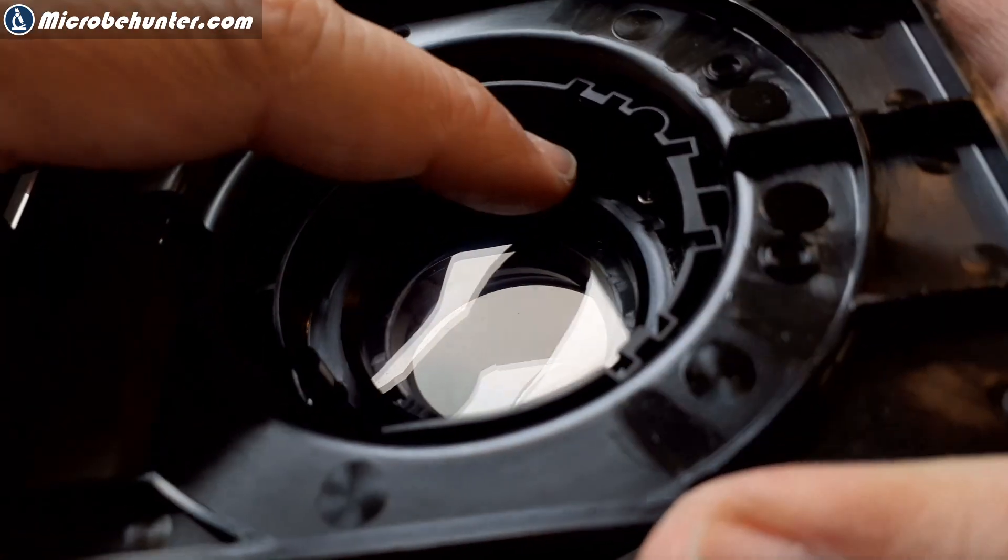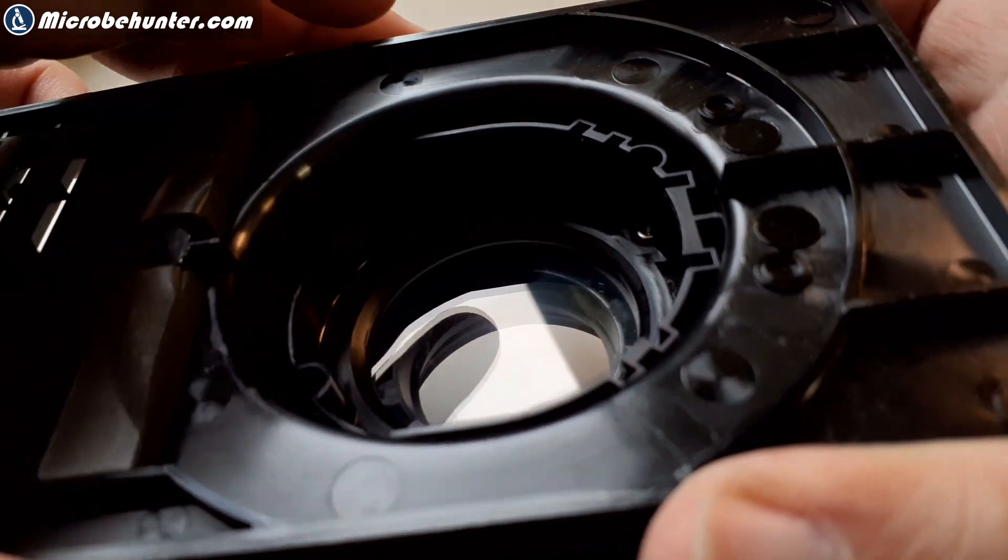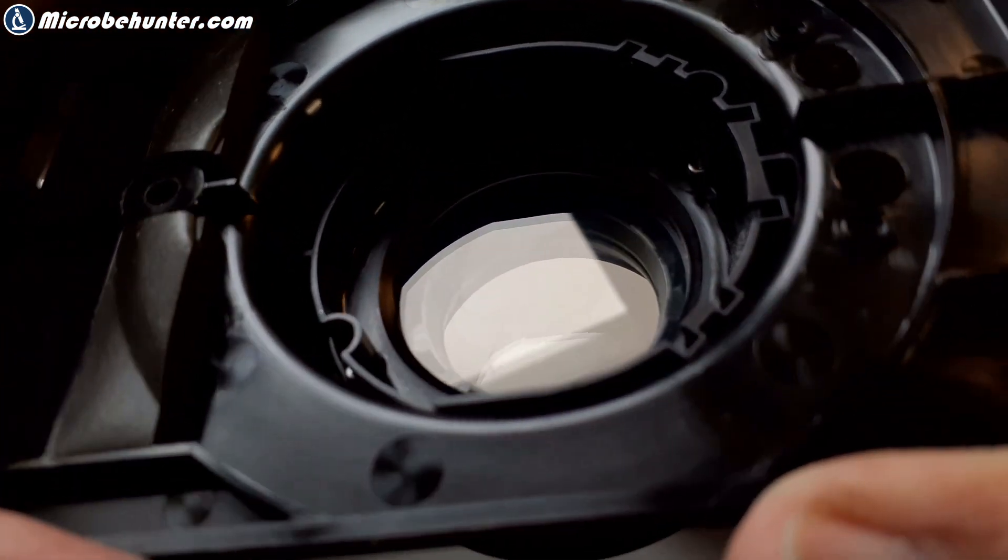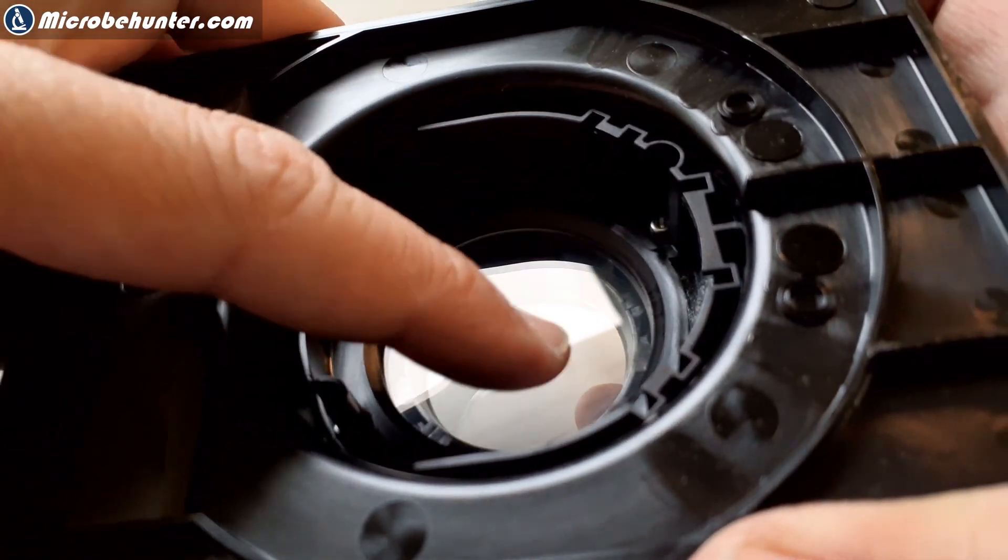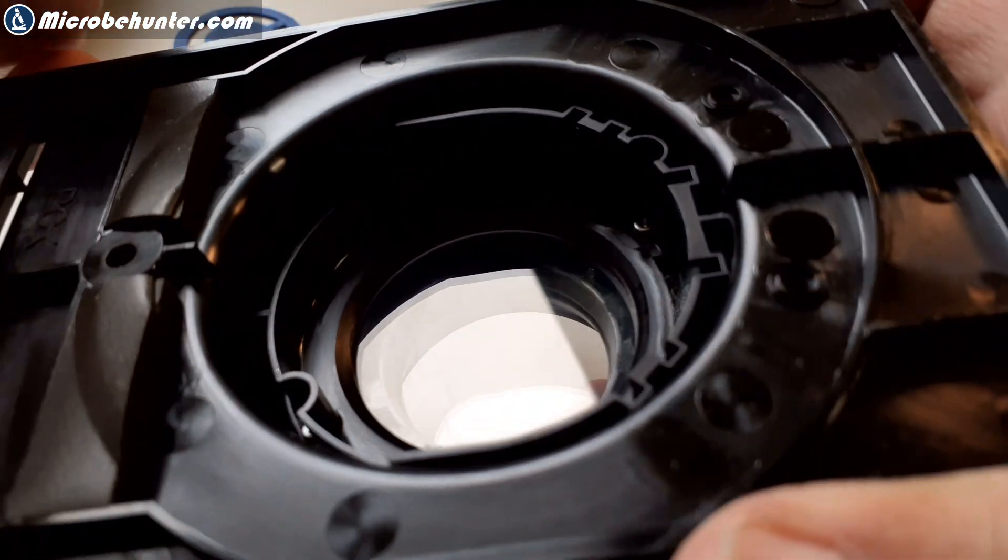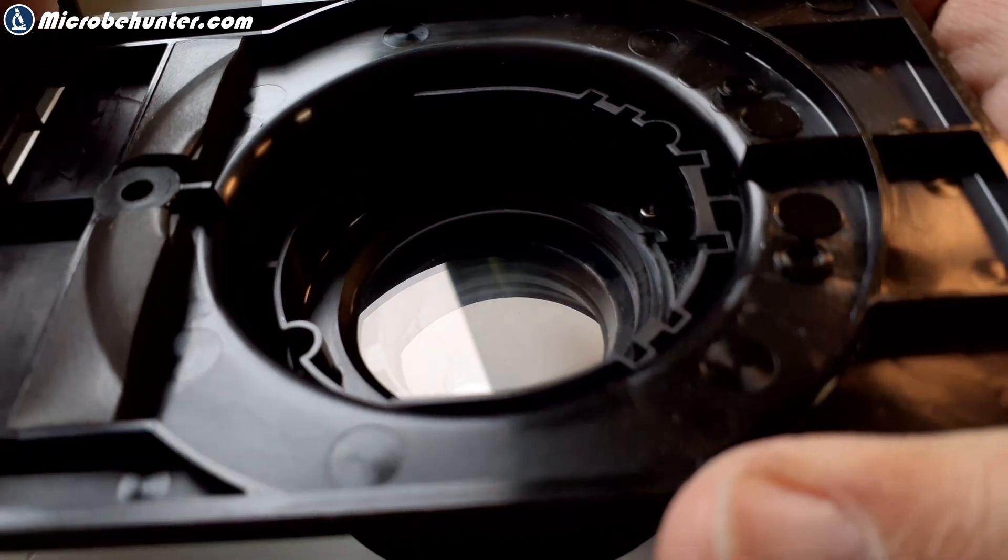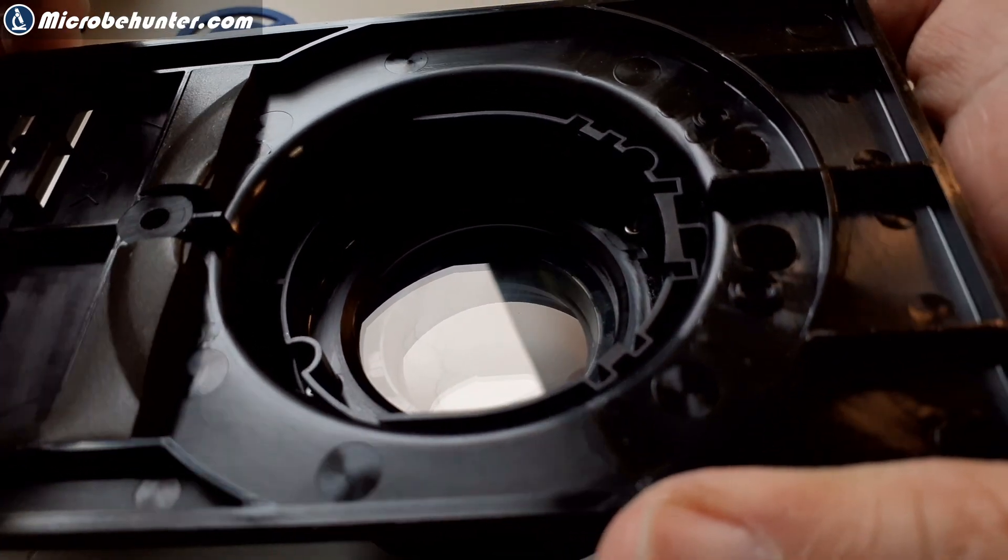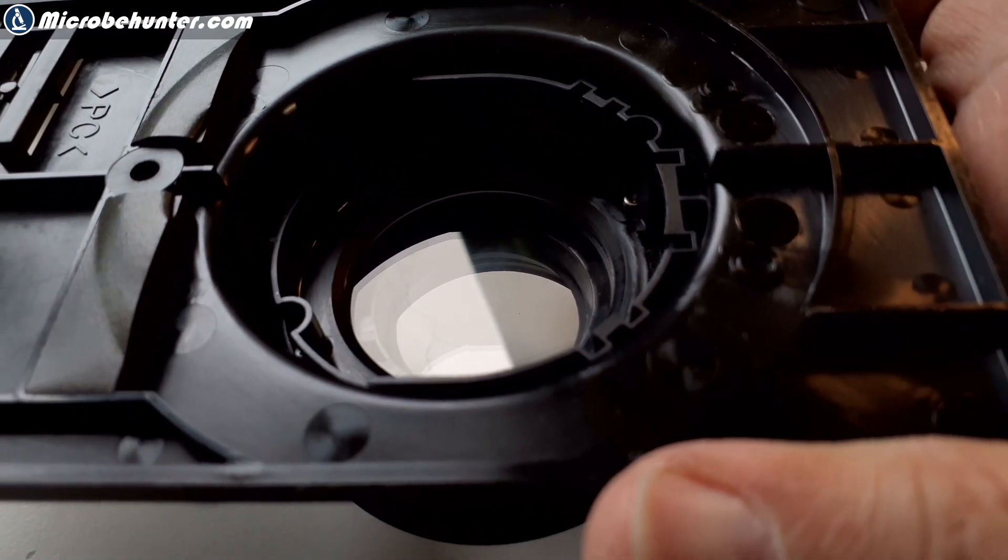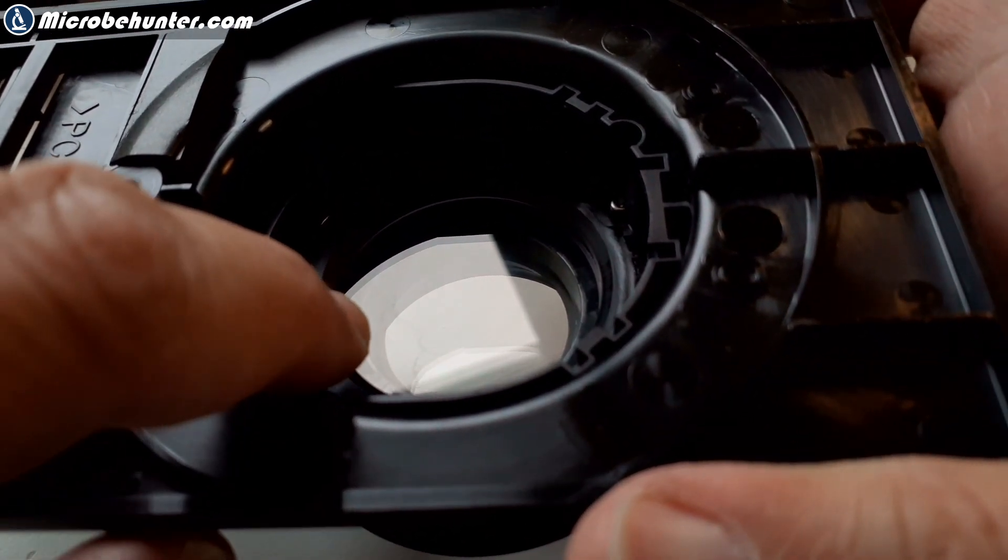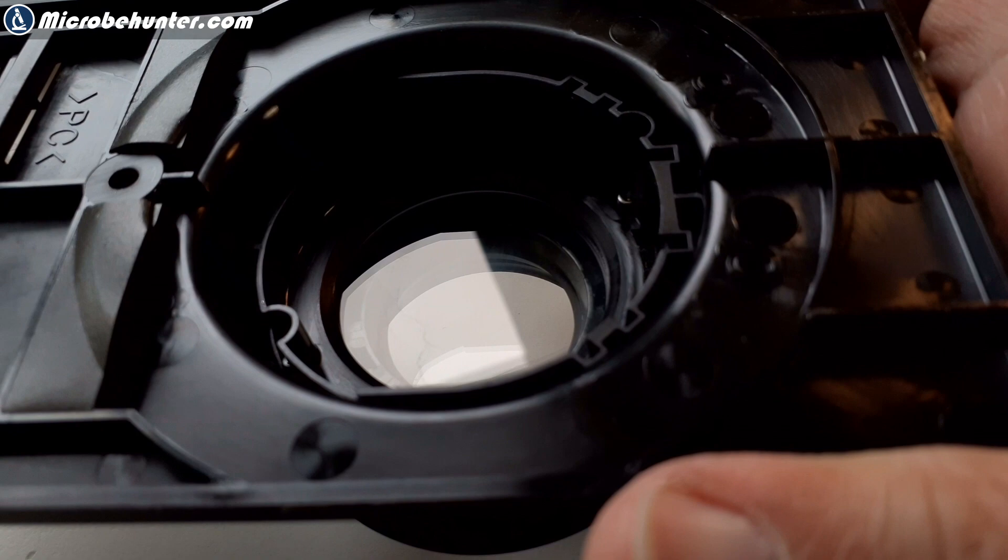When I basically touched it with my finger, I could actually see the dust. It's not grease from my fingers, what you see. But that is actually the dust which has accumulated on the surface. So simply using an air blower would not be enough, because this would not have removed all of this dust. Maybe you can see a little bit over there, the fingerprints.